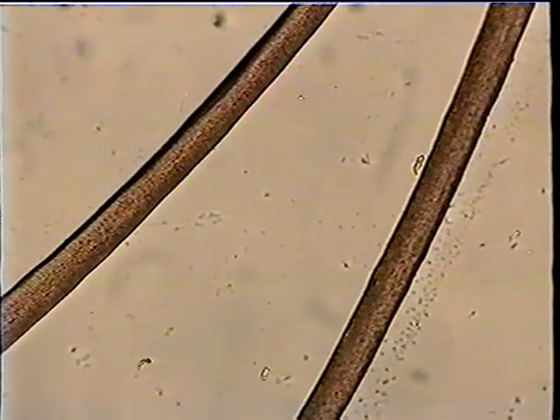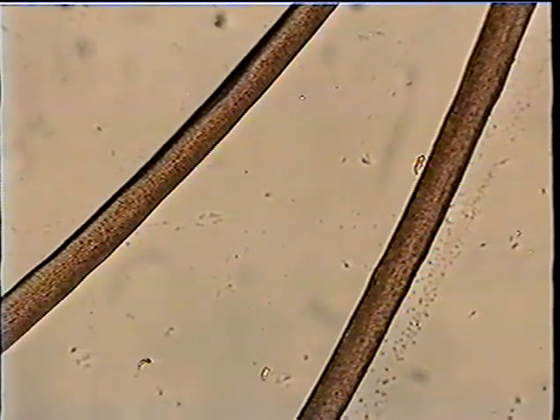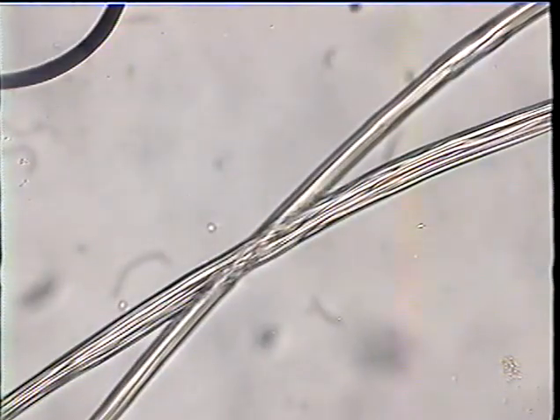A long time ago, this is an old standard slide of mine that I keep. It's about 40 years old, before I had gray hair. These were nice brown hairs. The scales aren't as easy to see, but the sort of cross-hatching on them are the scales. They are easily differentiated from most other animals, like rabbit. These are rabbit fibers. The two little ones are very fine fibers. Most of the fur is made up of those very fine fibers, but the guard hair, or the kemp down the lower left, is stiff and straight and keeps the fur fluffy, so it's a good insulator.